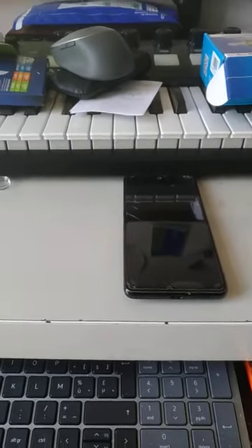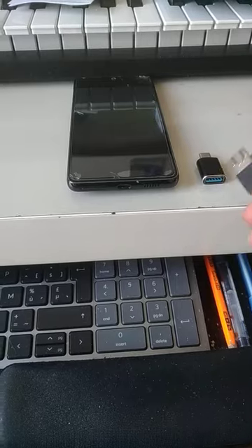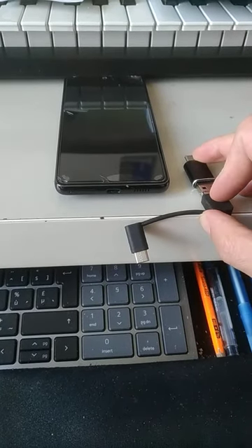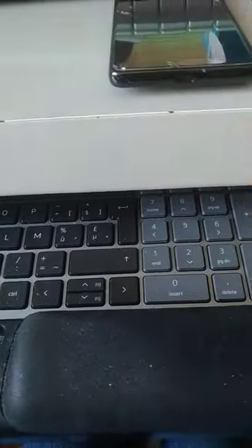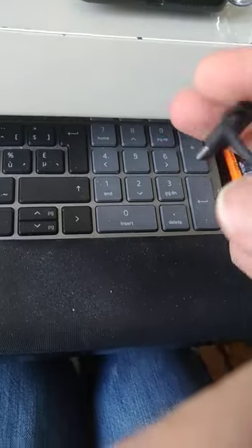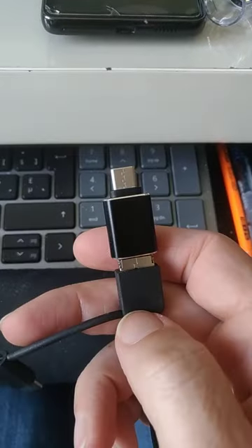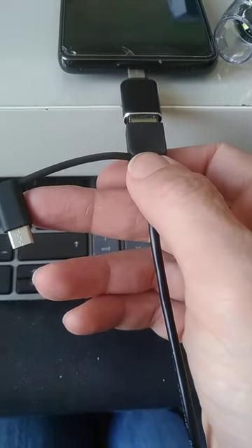So obviously, I can't use the regular USB-C. So fortunately, I have my own USB OTG adapter. My phone is OTG compatible because I am able to, in the end, use it with the OTG adapter. It's a little bit tricky. There we go. Okay, so again, I'll put it here. So now I'm using the regular USB with my own USB-C OTG adapter. That's something I bought separately.